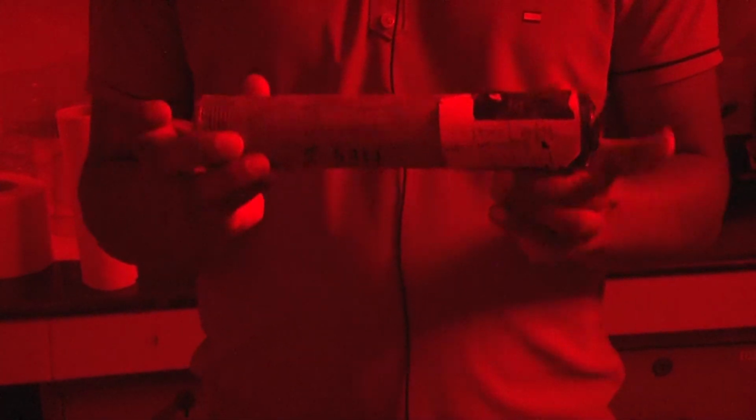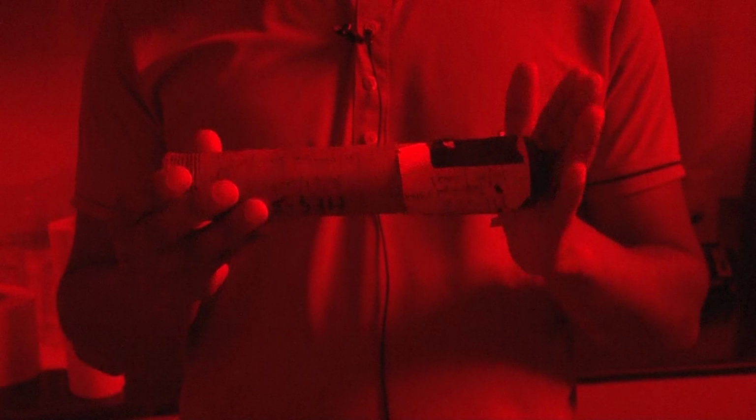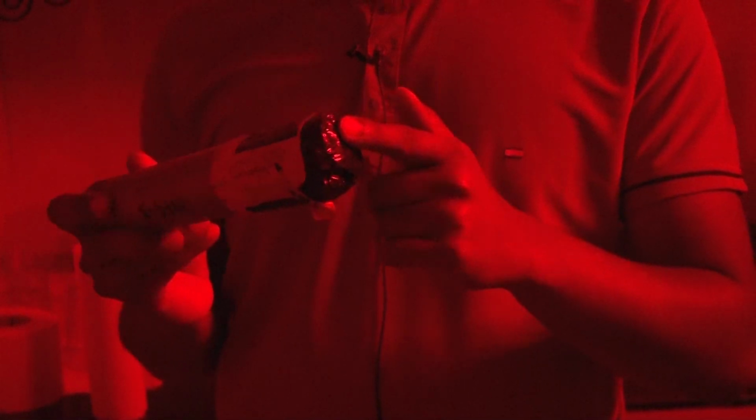Here you can see this is the aluminum pipe, and we collect the sample in such type of aluminum pipe. This pipe is sealed from one side, and the other side is open, and we insert this open side into the wall from where we want to collect the samples. When we have collected the sample, we close this side with cello tape, using foil and cotton, so that we avoid sunlight exposure for the sample.